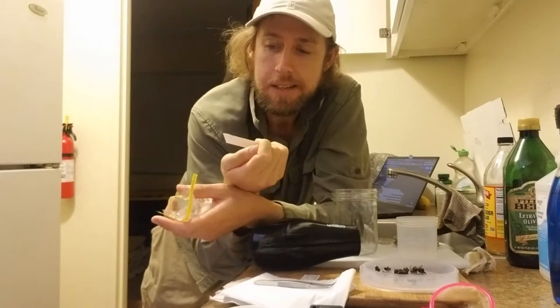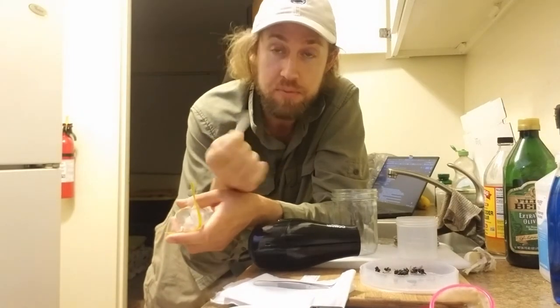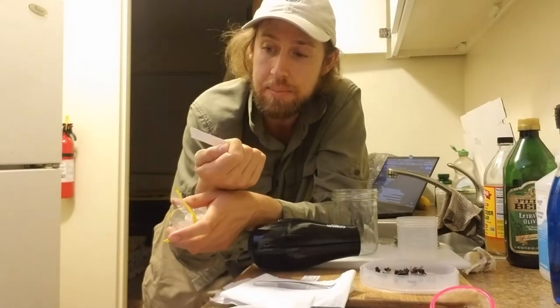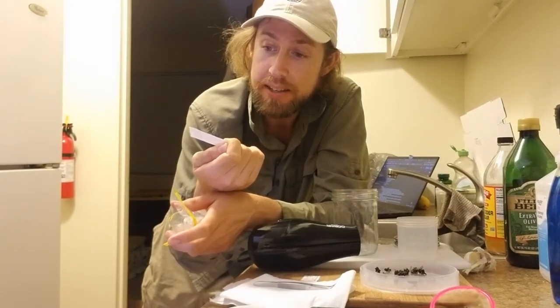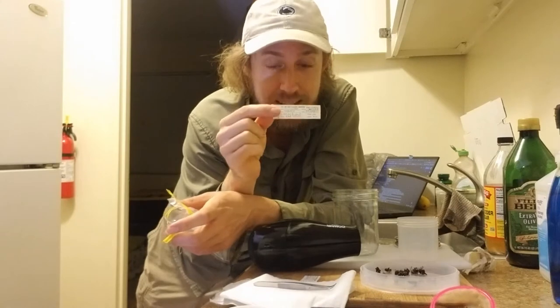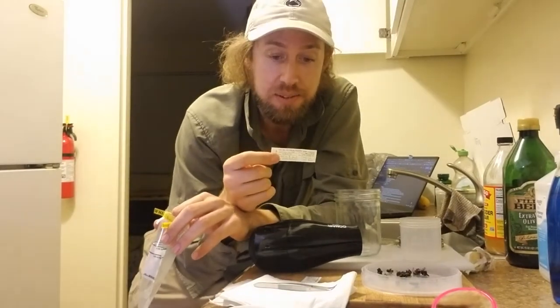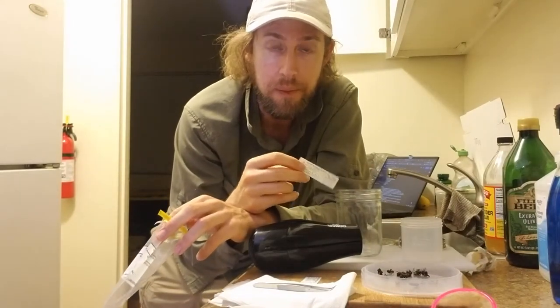A couple of notes on writing specimen labels: we want to write as legibly as possible. Writing in all caps tends to slow us down a little bit and keep our writing more legible. Also, this specimen label had a surprising number of sevens — seven sevens. The reason I mention sevens is because that is a number that can cause some confusion, because depending on how you write it, it can look like a one or a two. So I recommend everyone writing anything for scientific research write sevens with a cross. That cross really helps distinguish sevens from ones and twos.